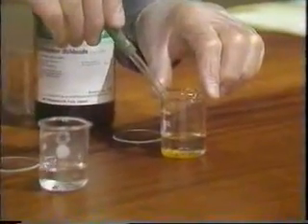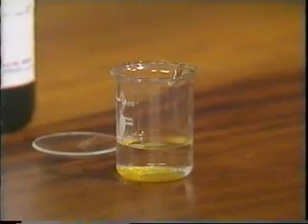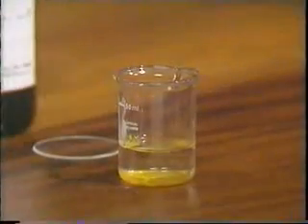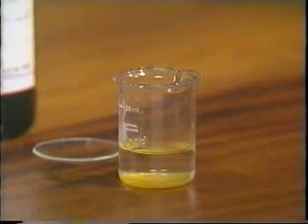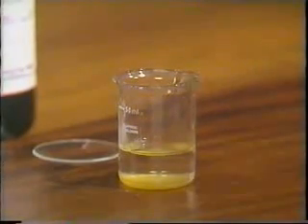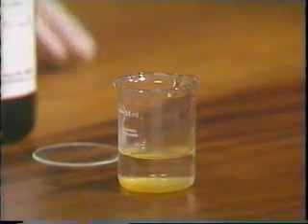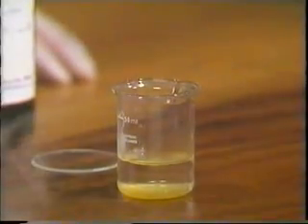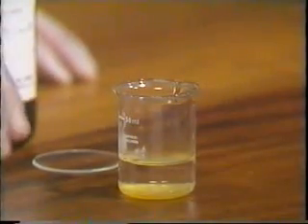And when I add this to the water, there seems to be little reaction at first, but you can see the water going slightly cloudy, and also if you look closely at the junction between the two layers, there is some sign of a reaction. The fumes you can see coming in are from the phosphorus trichloride, which is still going strong.